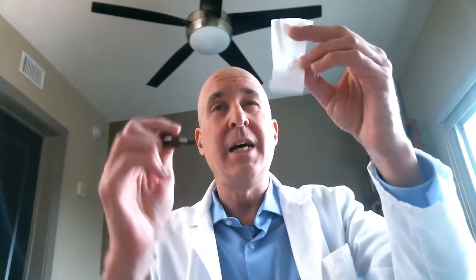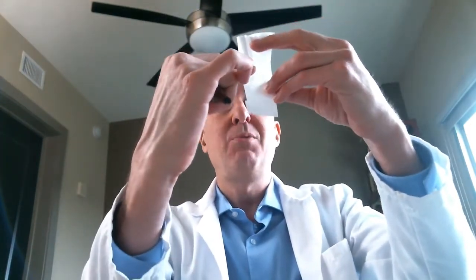And then I found a blue Sharpie. It's best if you have black. I don't have black, and you know we're all working at home, doing the best that we can do. And I have brown and blue. That's actually going to be pretty good. And what I want you to do is to draw a line at about the 60% mark. Not in the middle so much, but a little bit above that. So I'm going to do that.